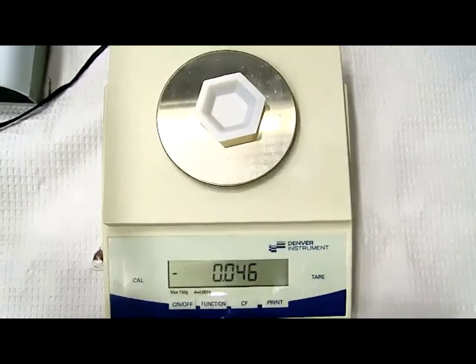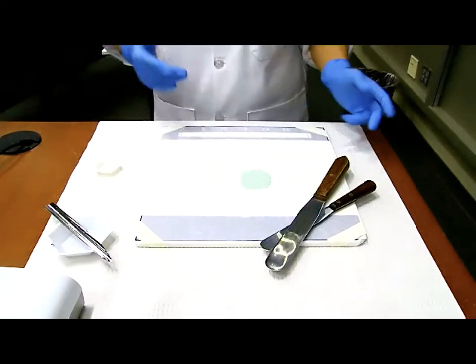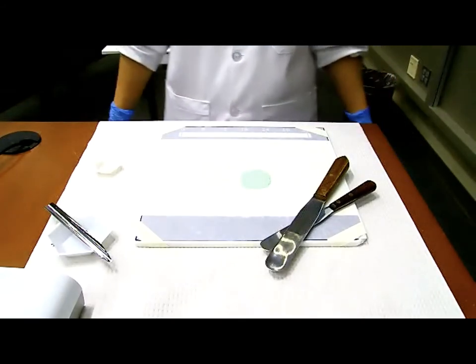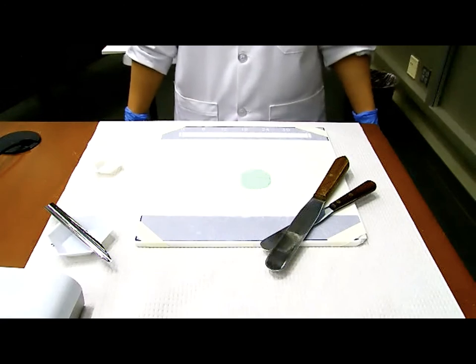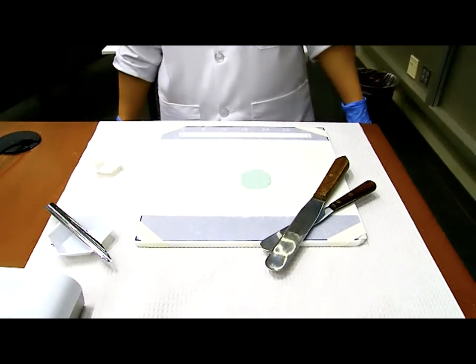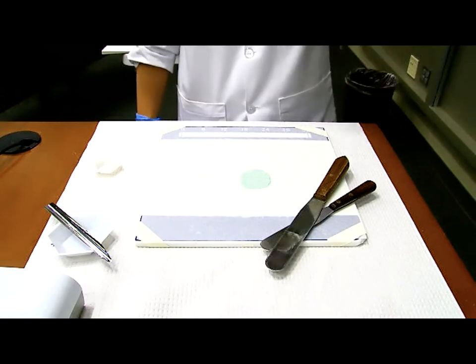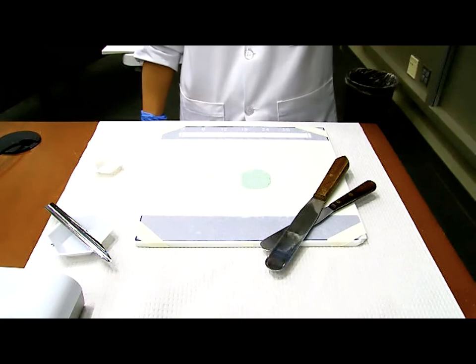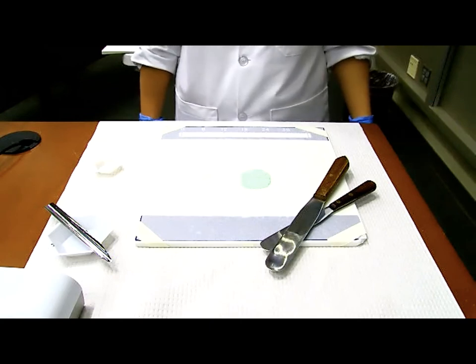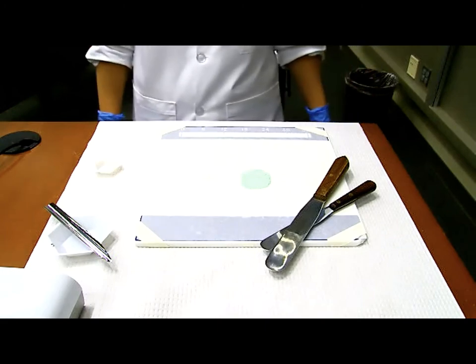Let me just emphasize this enough, because this is probably the number one reason why you will lose points on the exam for your product: you make the product perfectly, but it has the wrong weight because you didn't offset the weight of an empty capsule. So every capsule you punch starts by taring the scale with an empty capsule, so that when you take the measurement, you are only measuring the powder, not the powder and the capsule shell. That's a super important step.